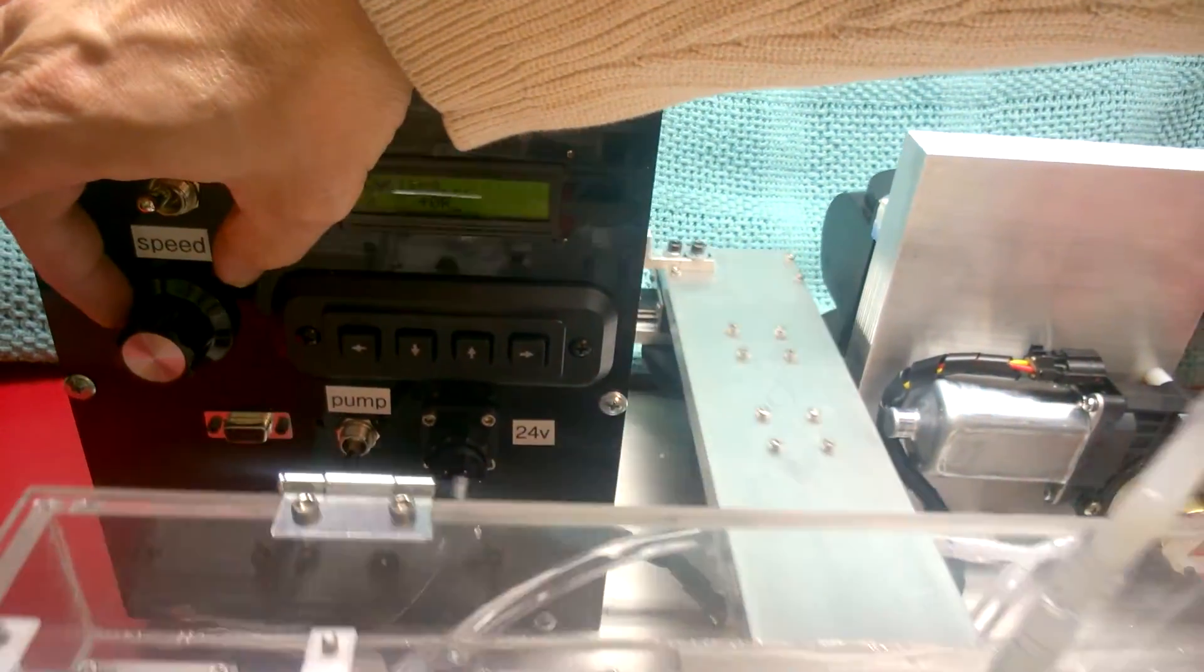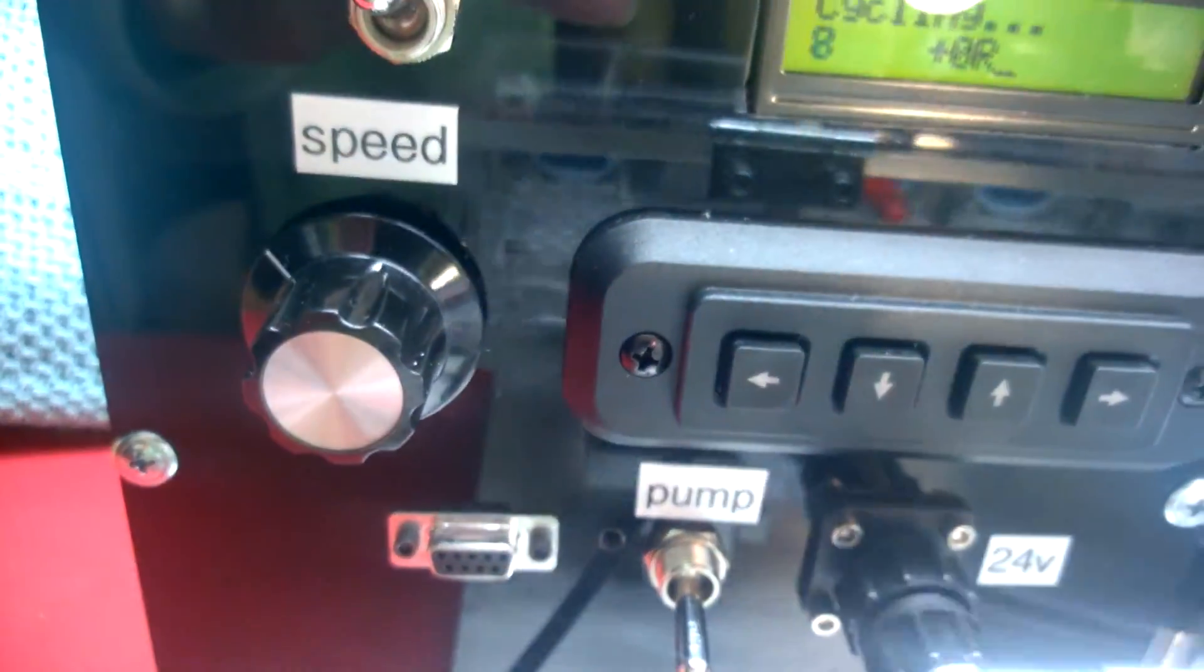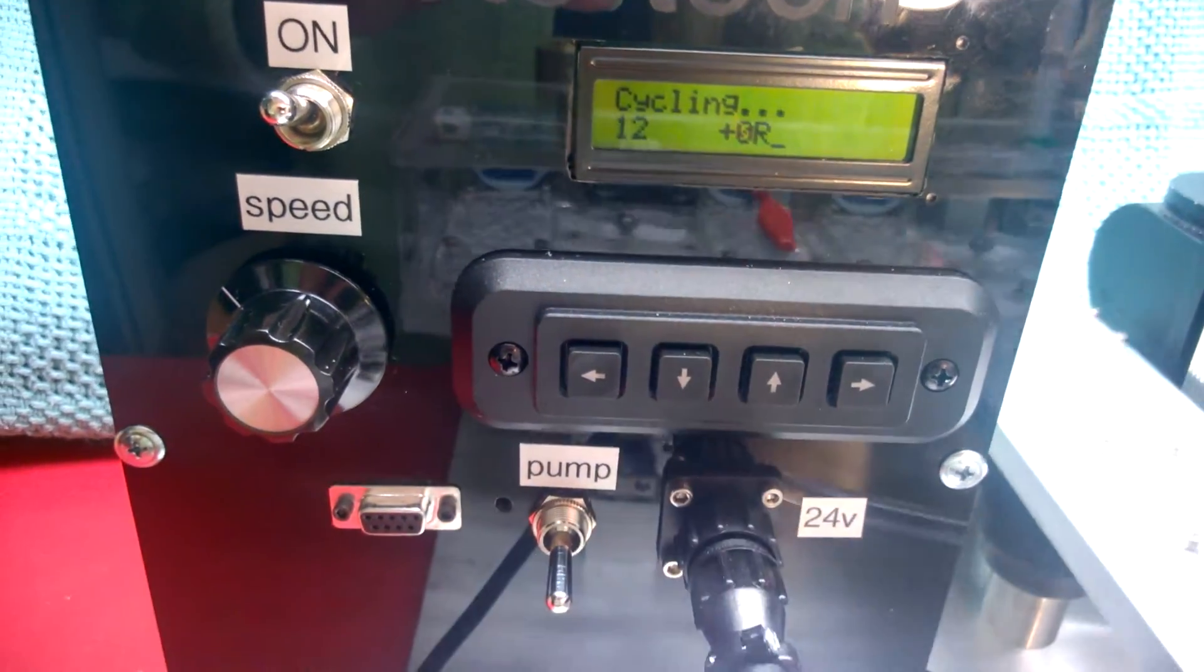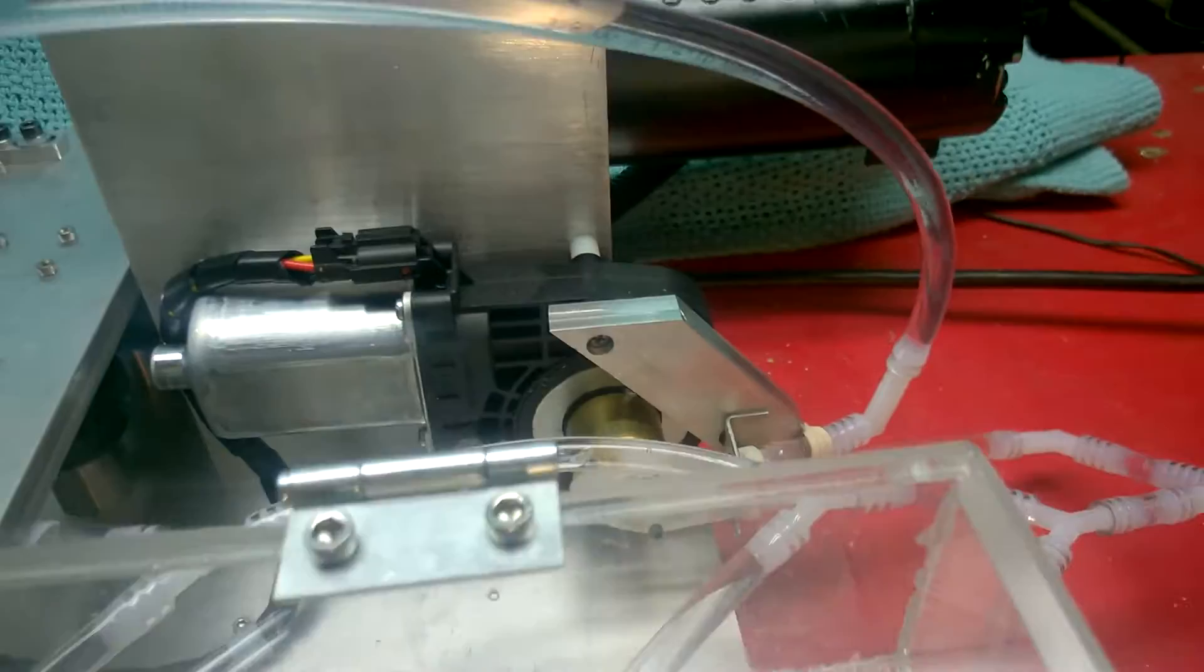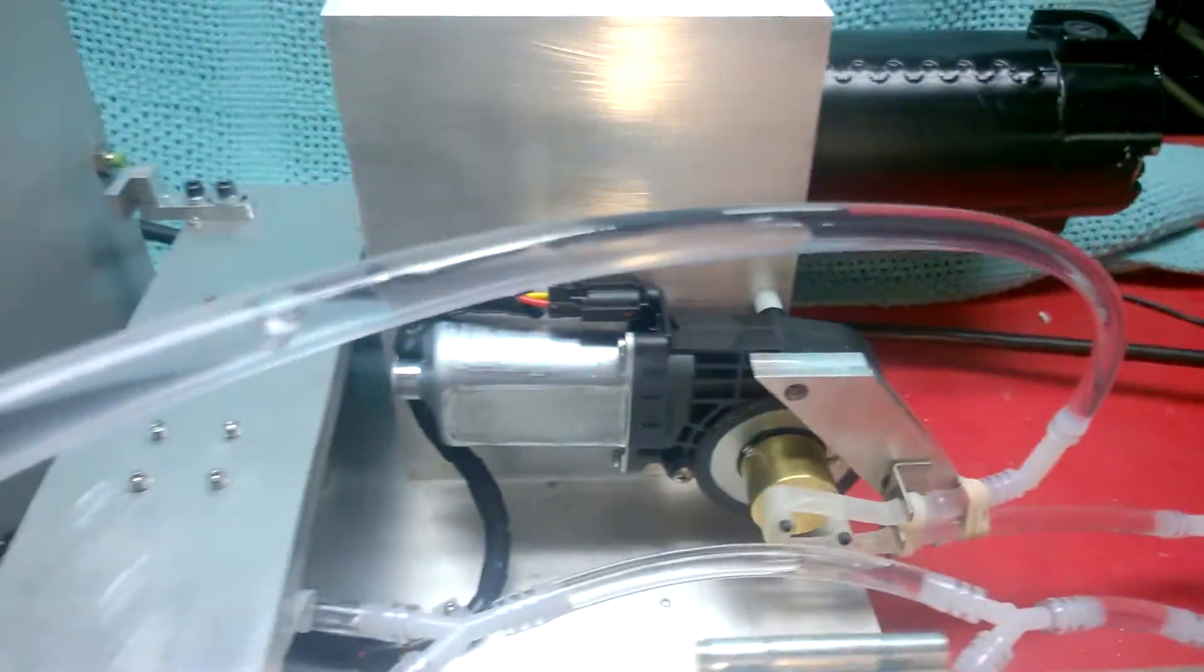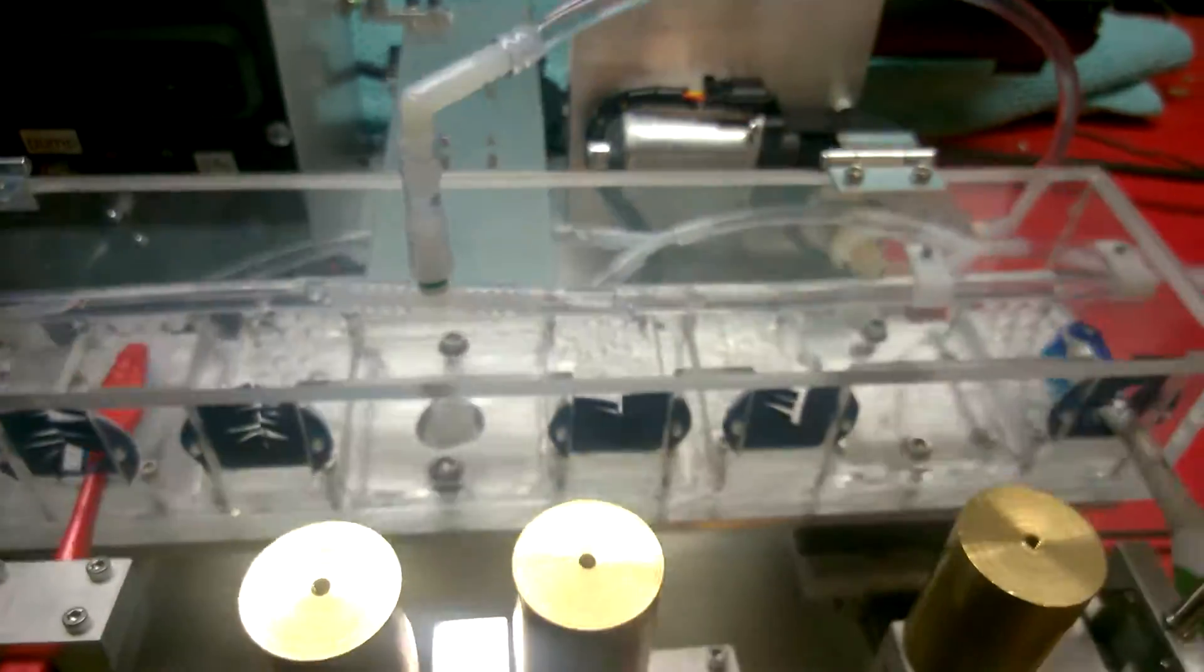The first mark on this wheel is, well, it's not on there yet. We're hitting the 60 RPM. We should turn on the pump as well. Get the recirculating slurry going through so you see the pump returning. And the fluid coming up to the chamber and see it dripping down on the specimens.